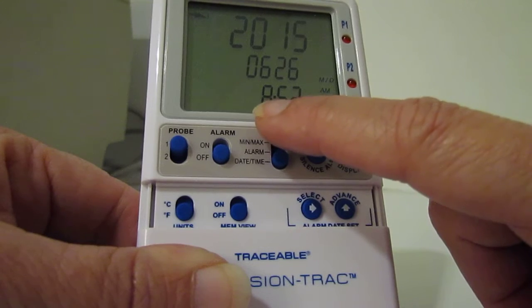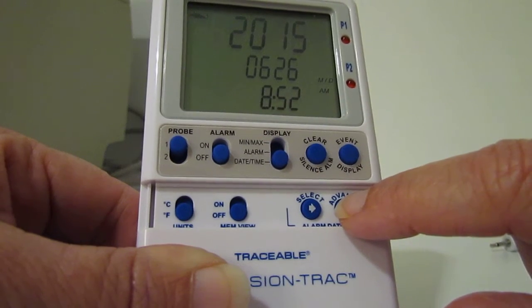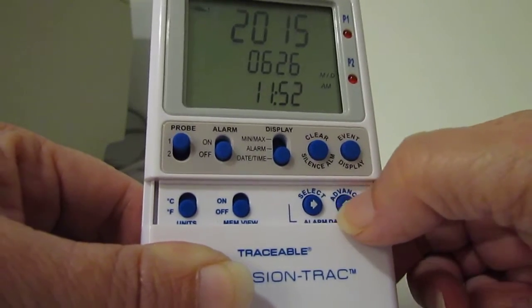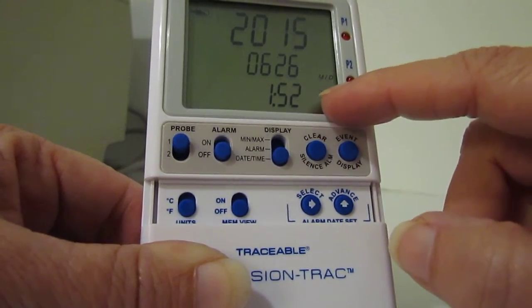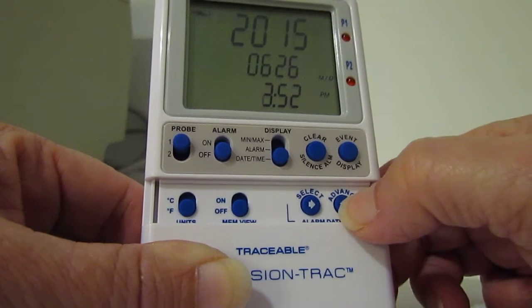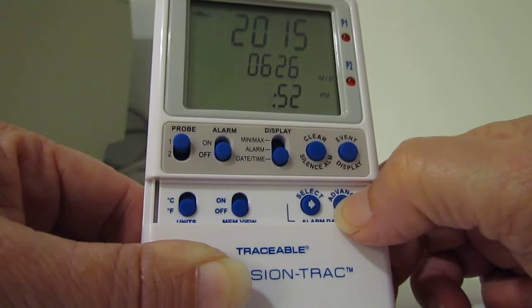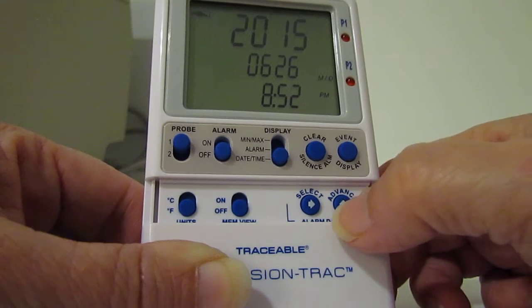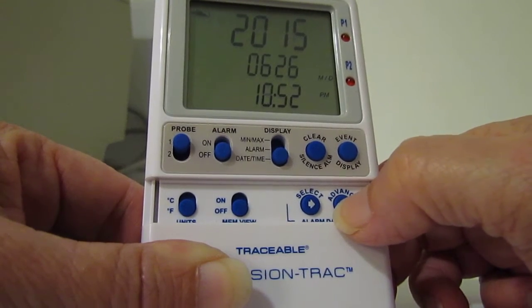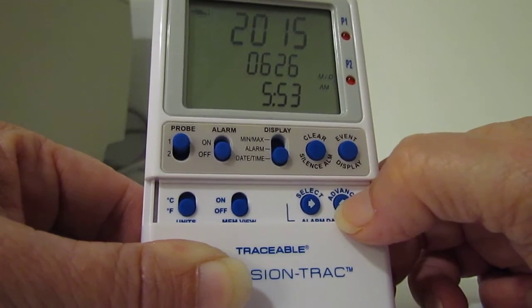Same thing with the time — press the advance key to get to the correct time. Also make sure your AM and PM is set correctly. If you're setting this in the morning, make sure you're setting it for AM, and if you're setting it in the evening, make sure you set it for PM.